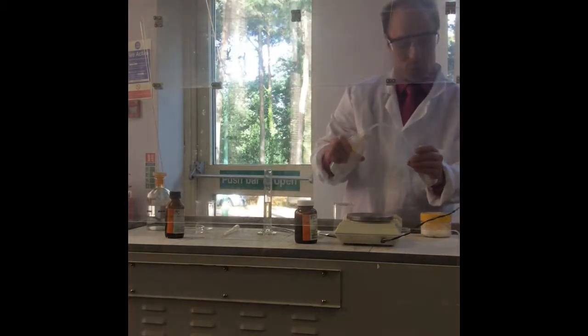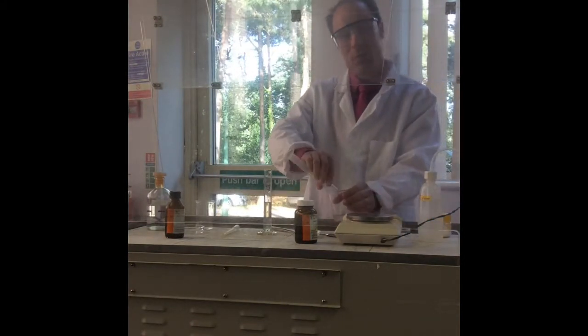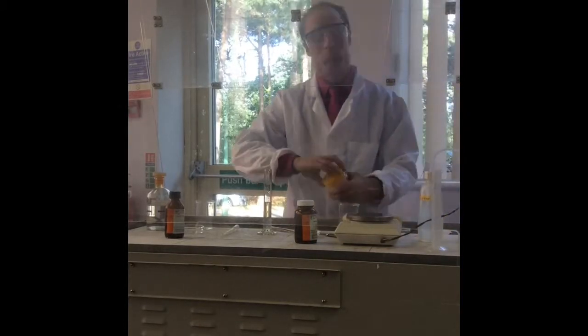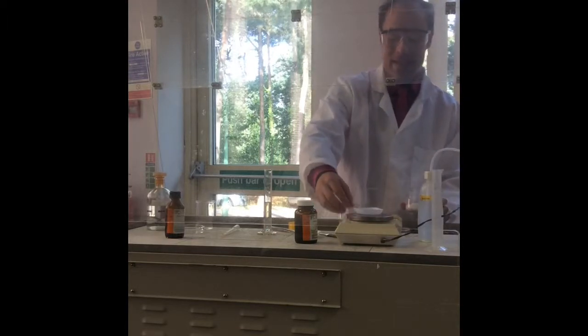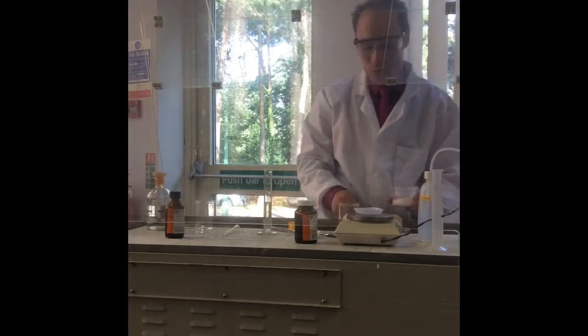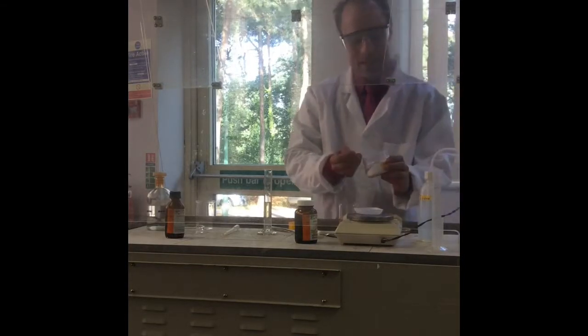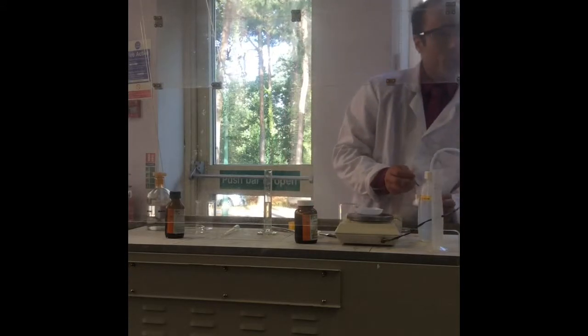Why would this dissolve in water, do you reckon? Because ionic? It's not, it's a diamine. So what's it got in it? Hydrogen bonds. It can make hydrogen bonds. But I also need to add into this about 2 grams of sodium carbonate. Why do you reckon I need to add this? Neutralize it? What product am I going to make?